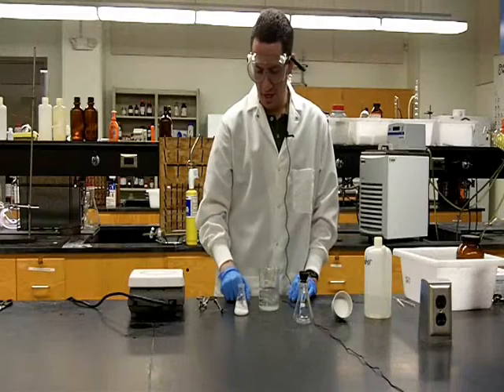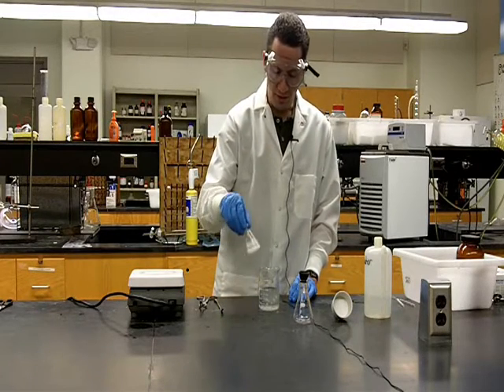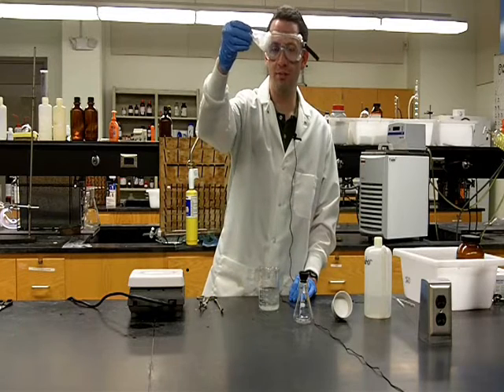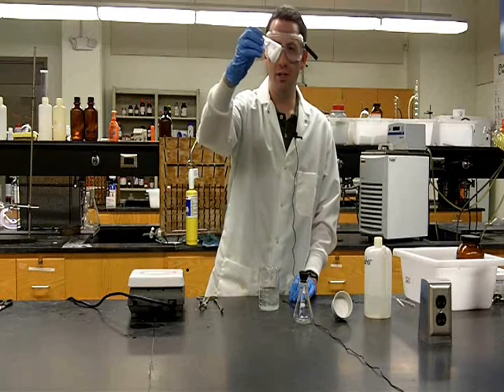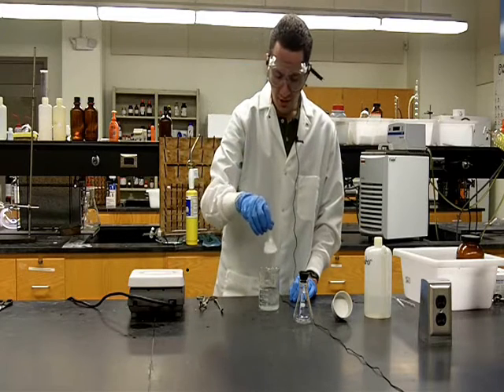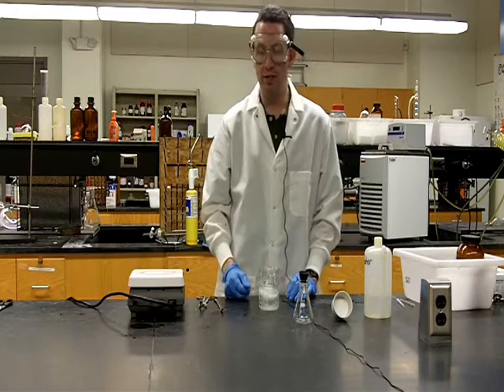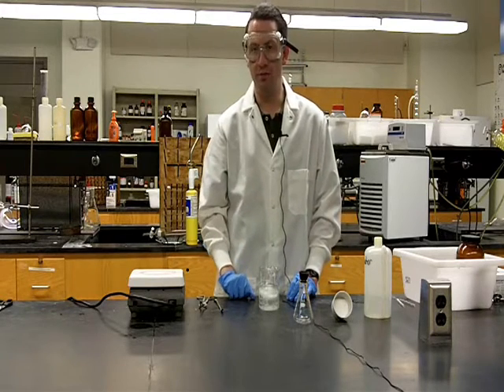Okay, now that our benzoic acid and water has reached room temperature, we're ready to place it in an ice bath. You can see by looking at this flask, we've gotten significant crystallization as we have a lot of solid in this flask. So I'll now place it in an ice bath, and we'll let it remain in the ice bath for about 5 minutes.